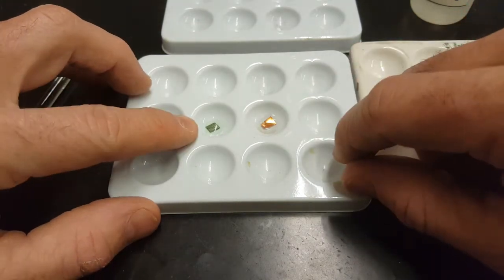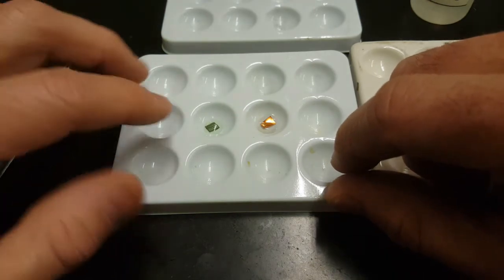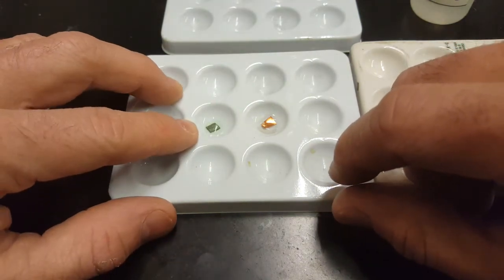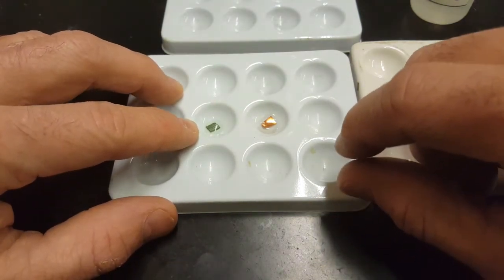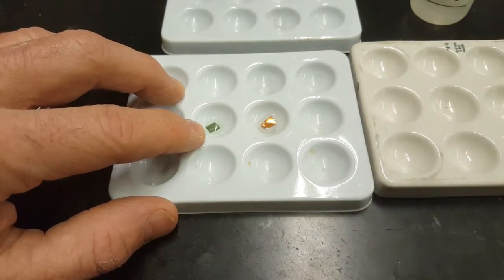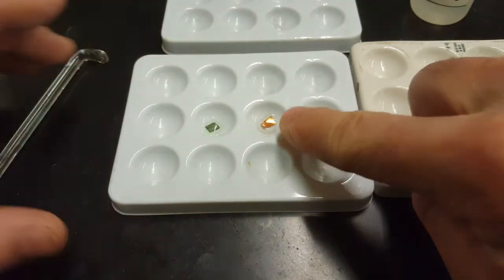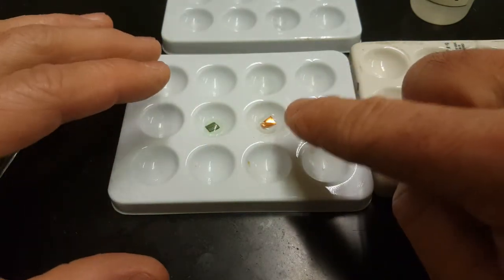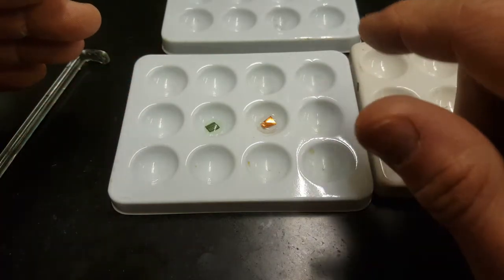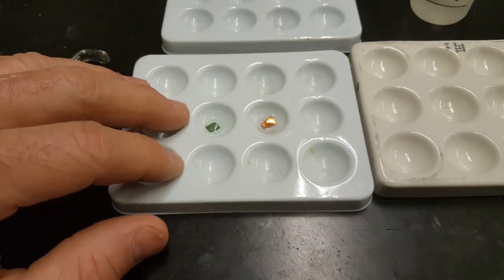All right, our magnesium piece is getting even more black as we sit here and talk about it. Over time, that color might actually turn a little bit red. And you only need to do one of these tests. If you're testing magnesium versus copper, then use one of the metals and one of the solutions. You don't have to reverse that reaction.